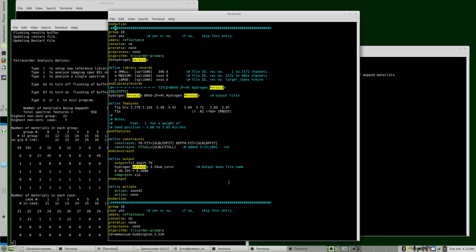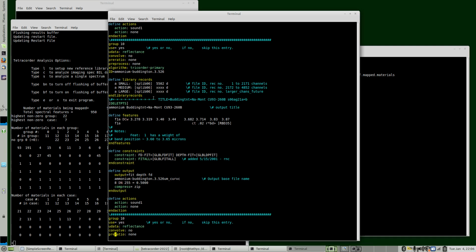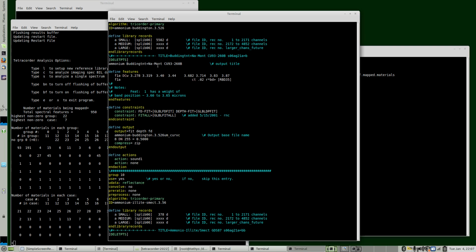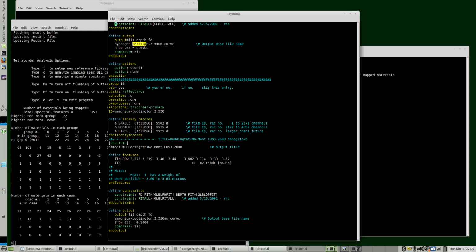An addendum, because we didn't change the Tetracorder result, I looked at the ammonium compounds in more detail, and I added 2 more ammonium compounds, and I called this version RC2 down here. So here's the peroxide. I adjusted the continuum slightly because the analysis of the continuum showed it could have been optimized just a little bit. Then we added, previously, the ammonium buddingtonite. That's unchanged. I did fix the spelling on ammonium, and I added the more precise band position for here. I also changed the band position to be more precise on the peroxide, 3.54 microns.